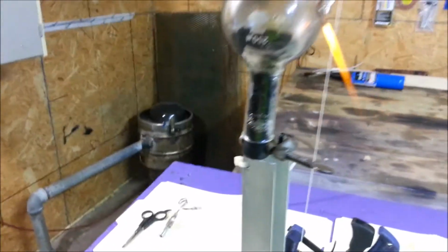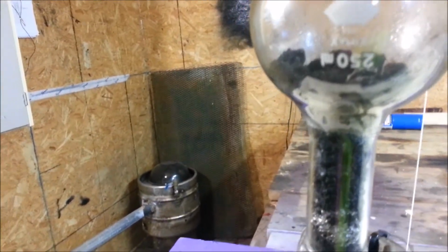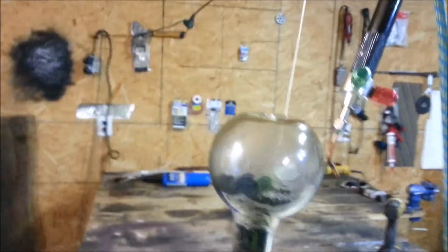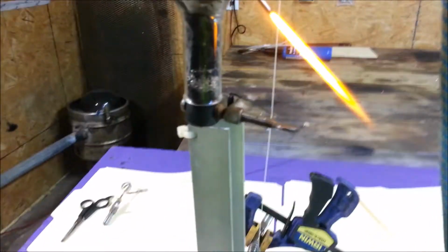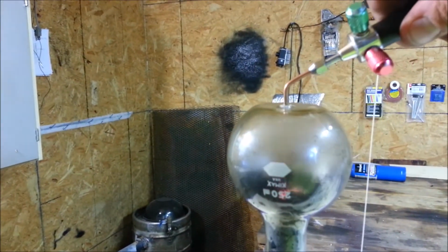I'm not a fan. This really sucks. Nope, it's still out. I don't know why. Keep going out. It's killing me here. Okay, maybe I should just put the biggest torch tip on there and try that. We're going to change tips. Okay, here we go. It's kind of risky. There's going to be a huge flame in here. Still goes out on us.